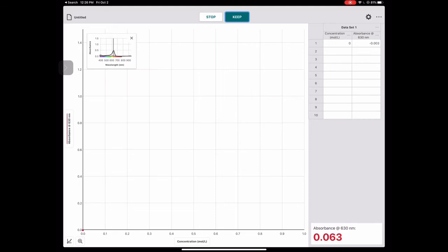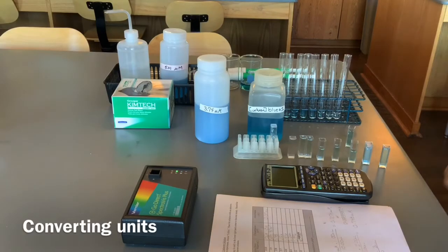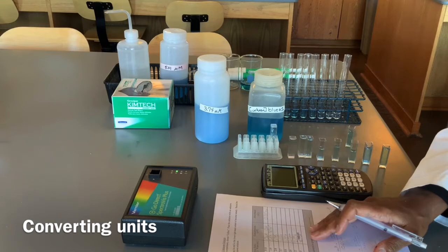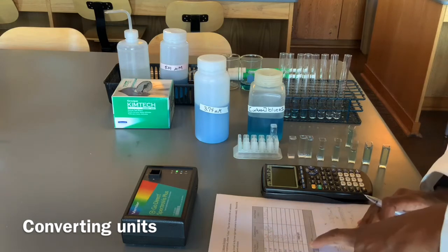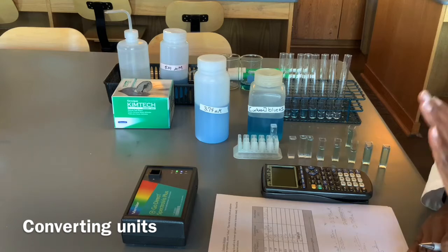Note the absorbance and record it in the data table on your lab and press Keep again. Be sure that the concentration you enter is in moles per liter, not micromoles per liter. At this point, you should have already calculated the concentrations of each solution, but note that those units are in micromolar.